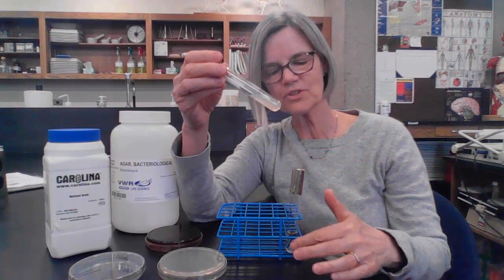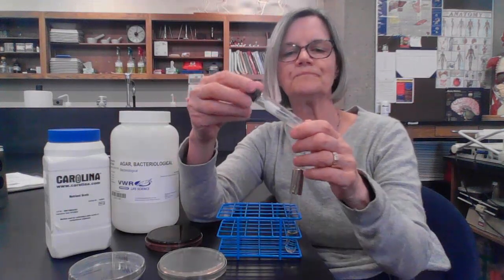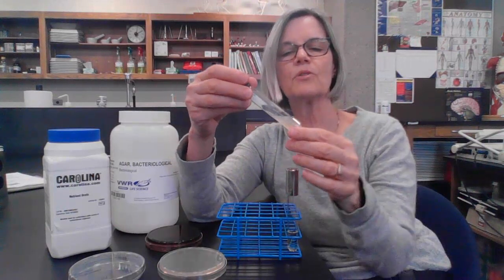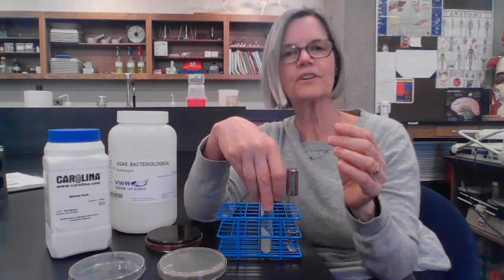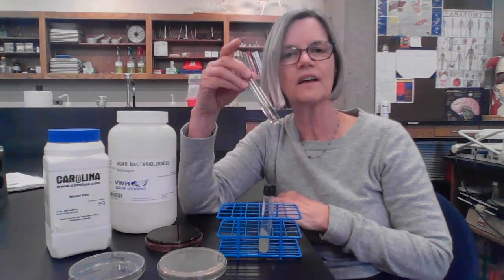And so what you can do is you can take some of your bacteria, streak it onto the surface of that agar, and store it for a little bit longer period of time, because this liquid's going to dry up. Whereas if I grow bacteria on the surface of this slant, I can grow it overnight, and then I can tighten the lid and put it in the refrigerator, and it lasts generally up to a month or longer. So agar slants are a really nice way to save cultures for longer periods of time than broth cultures.